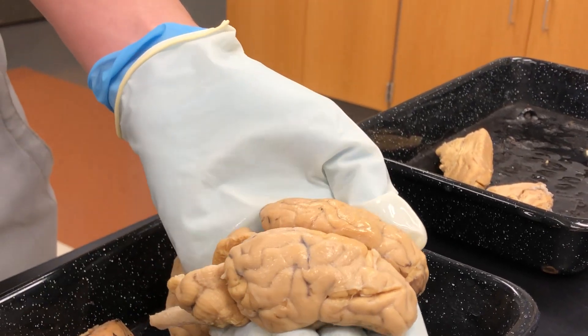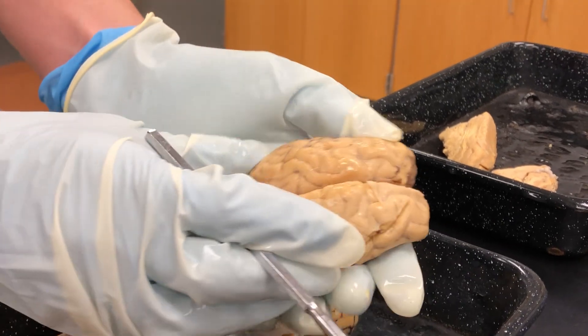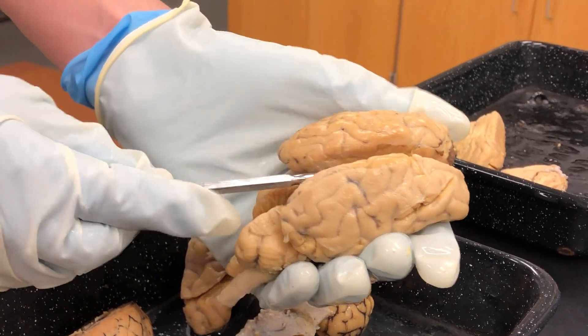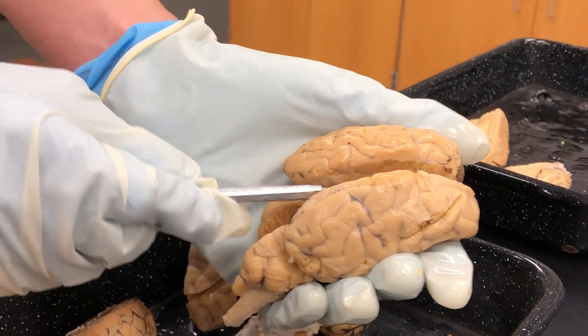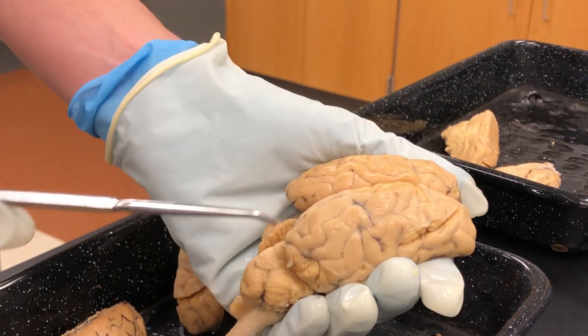We also need the longitudinal fissure. The longitudinal fissure separates the left and right hemispheres. So this is the longitudinal fissure right here.